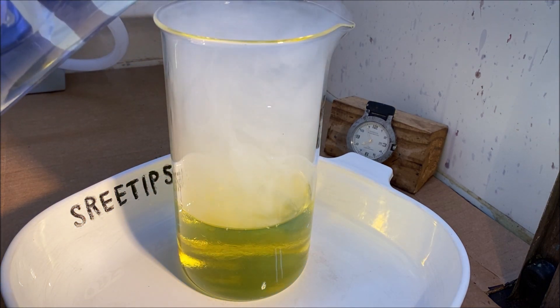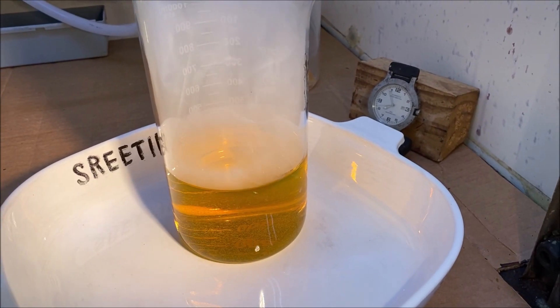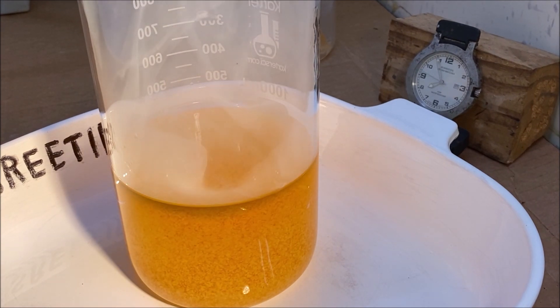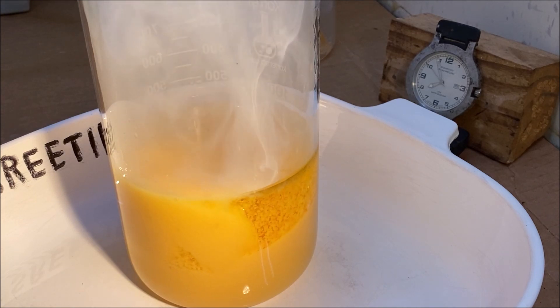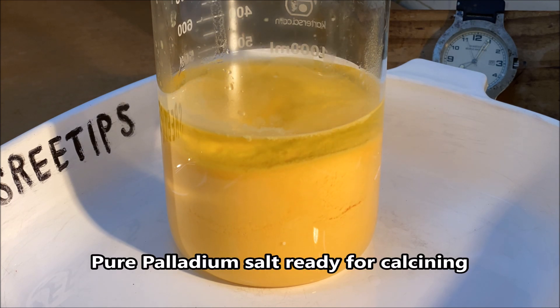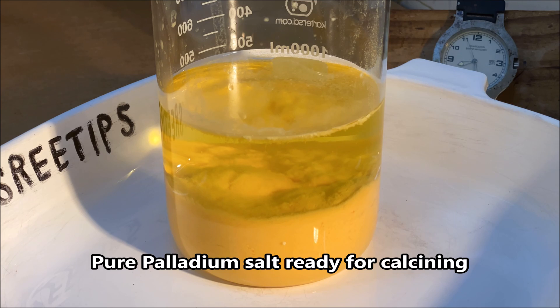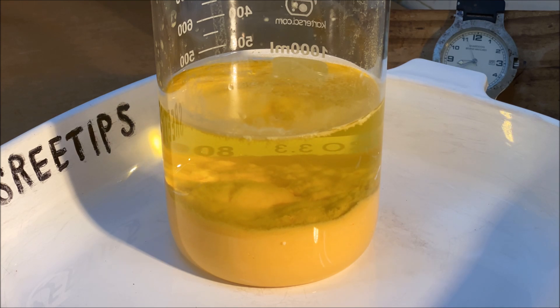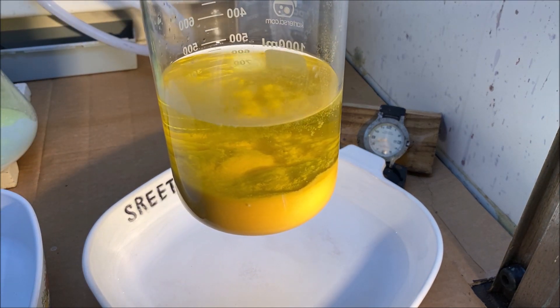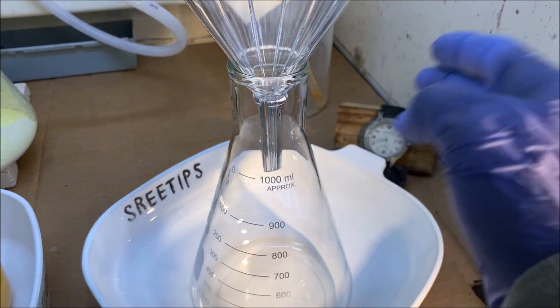See, that's turning yellow? A precipitate is starting to form in there. I think that should do it. We're almost home. This is our palladium salt. We're going to filter it out of this solution now and gather it up in a filter paper. It's turning orange in here!